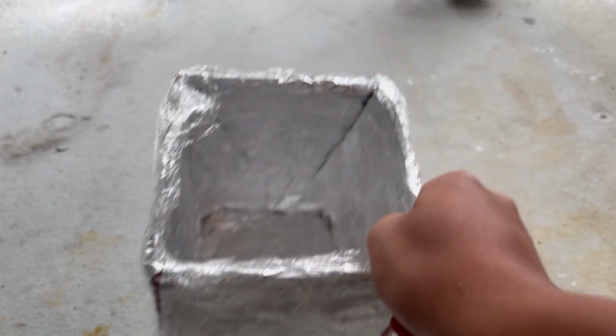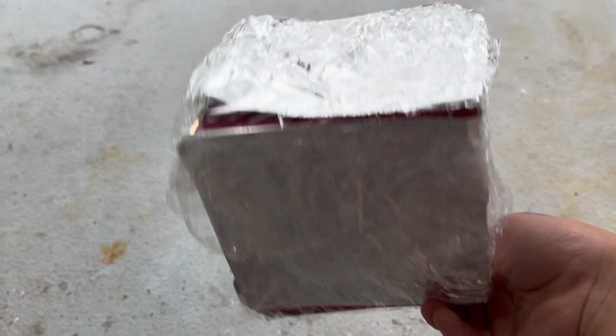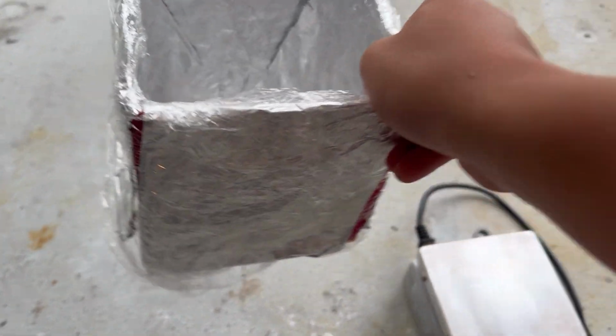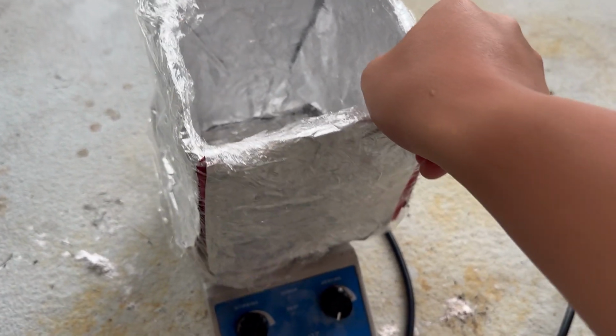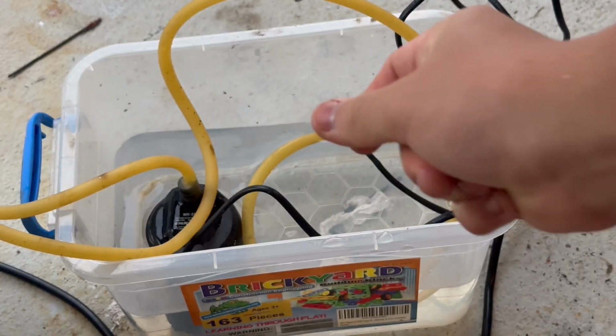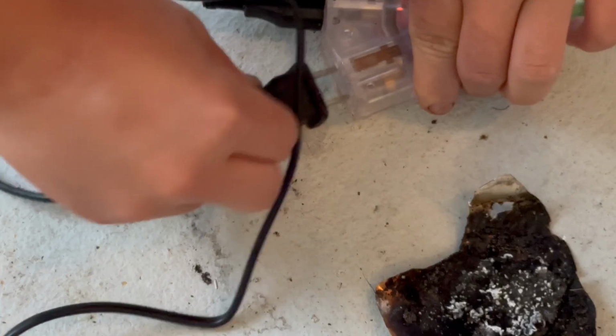Now, usually I would just use an eating bowl for this, but apparently this strange new concept called food safety has just been brought to my attention, so I'm forced to use this paper box covered in aluminum foil and plastic wrap. After filling up my water bath, I can turn on my condenser.